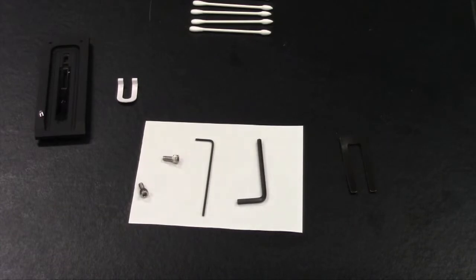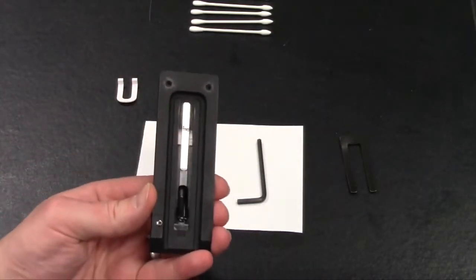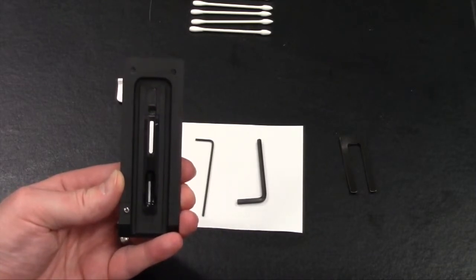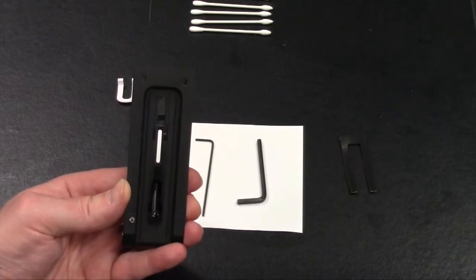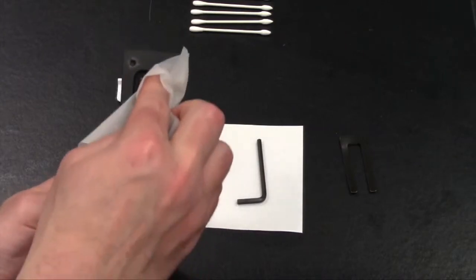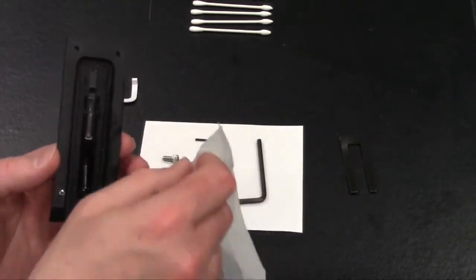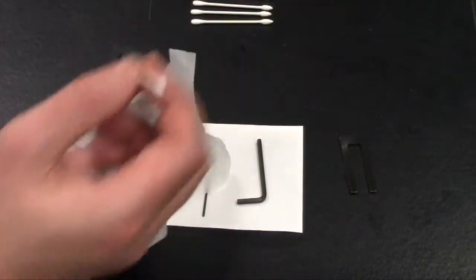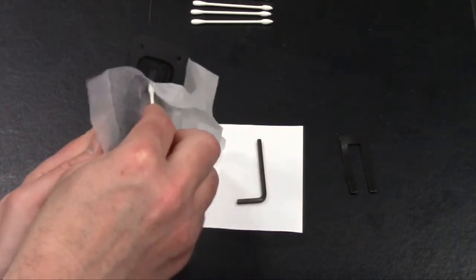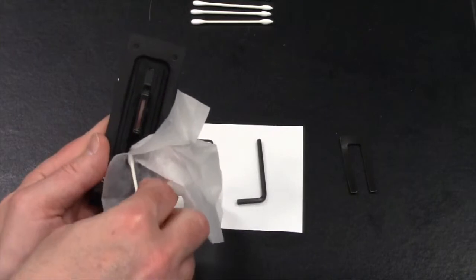Next, we will do the same thing with the base of the slide assembly. This base is actually a little more critical because you have a plastic lens that helps protect the optical mechanism in the Easy Reader. So again, use that first soap towelette we provide and clean this as best you can. If needed, while you clean this, you can also take one of the supplied swabs and use the swab itself as a means to get in and try to clean the lens into different corners and crevices as best as possible. Okay?